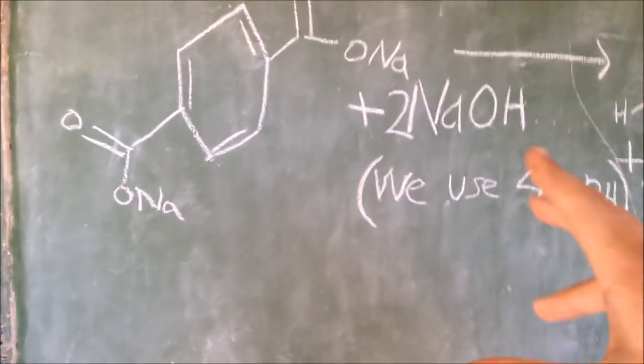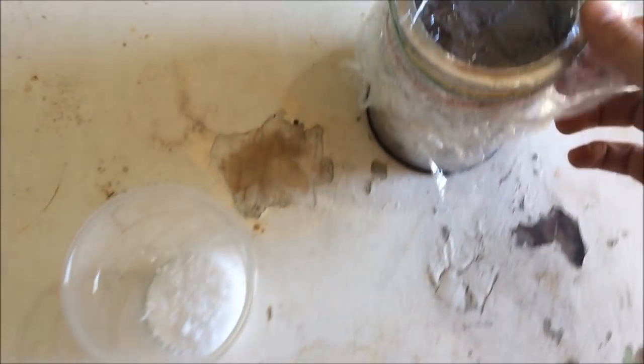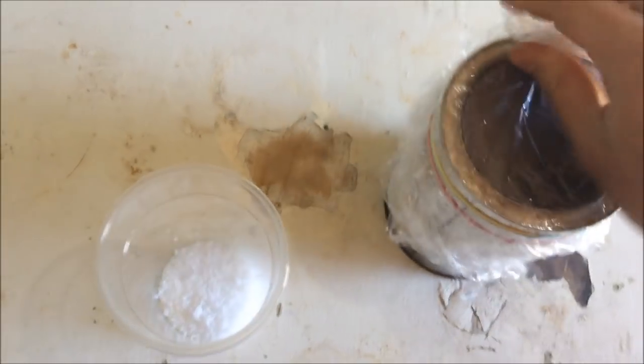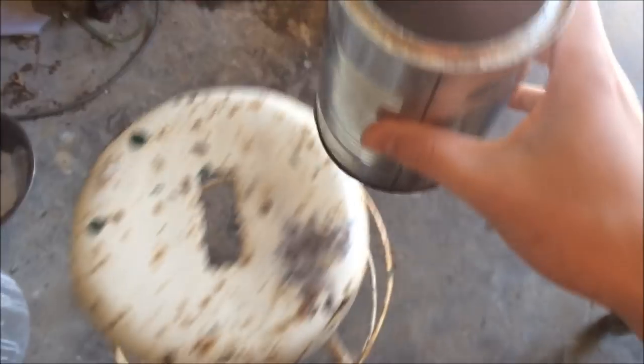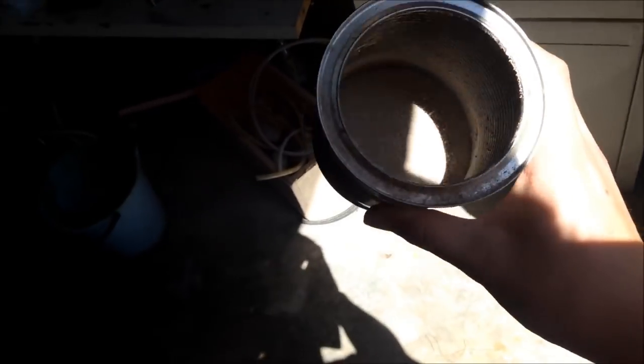Yeah, it's a lot better using sodium benzoate, but yep, we're doing it from plastic, so we'll continue on. All right, here is 47 grams of sodium hydroxide, which we will add to our 55 grams of sodium terephthalate, which is in there keeping dry. It's a horrible brown chalky powder. I don't know where I went so wrong.